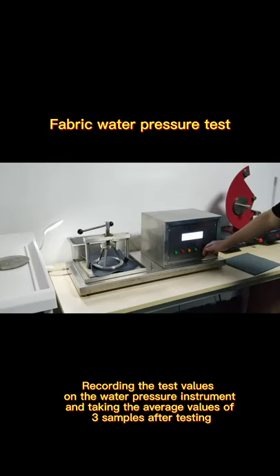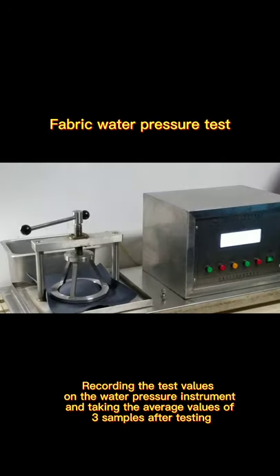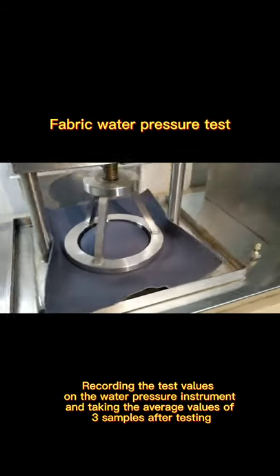Recording the test values on the water pressure instrument and taking the average values of three samples after testing.